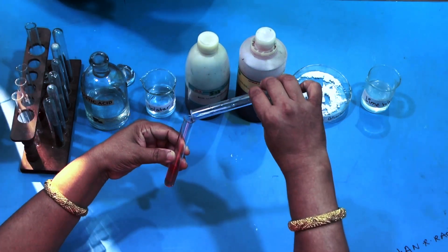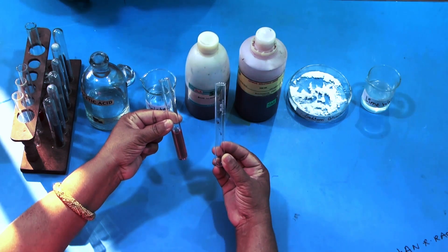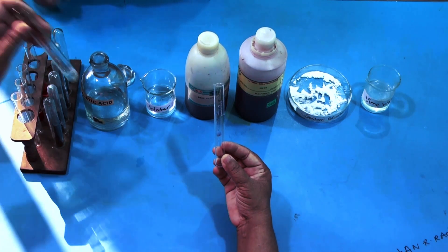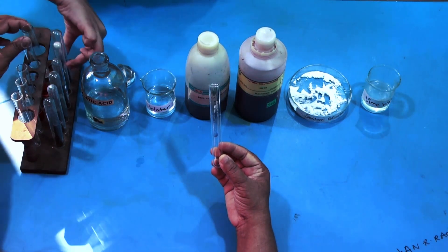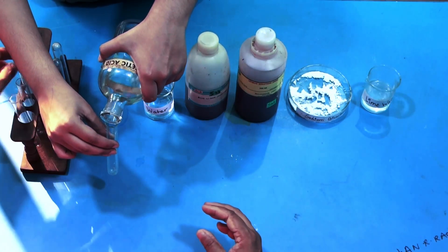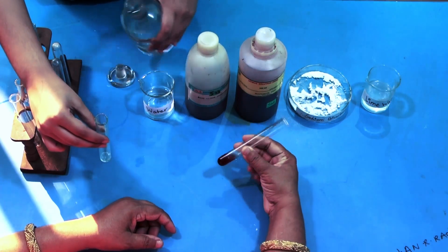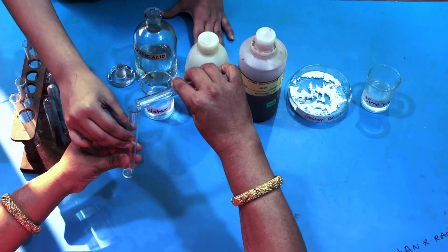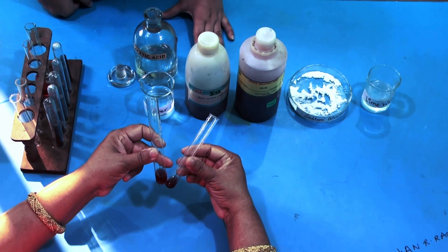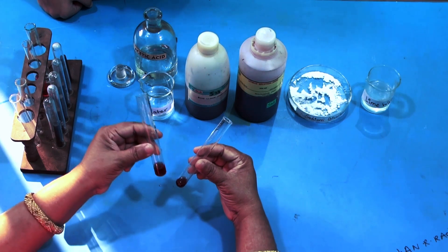This shows that acetic acid is acidic in nature. Now taking acetic acid in another test tube with red litmus solution, which is red in colour, and pouring it into the acetic acid — what we observe is red litmus remains red only, and blue litmus turns red. So this shows that acetic acid is acidic in nature.